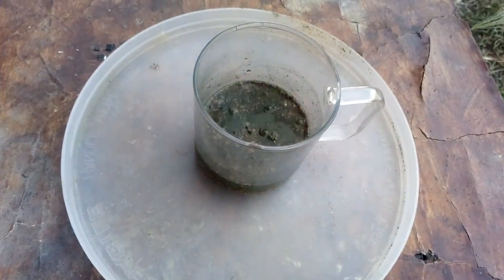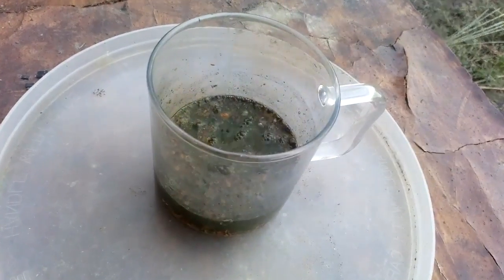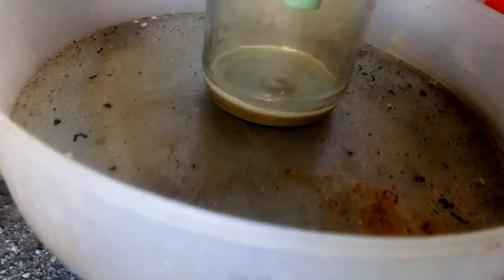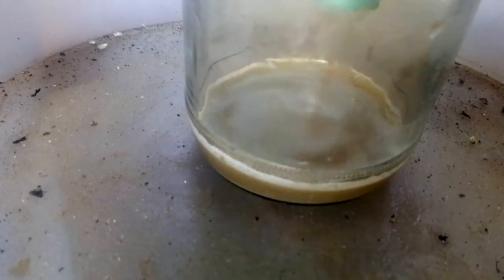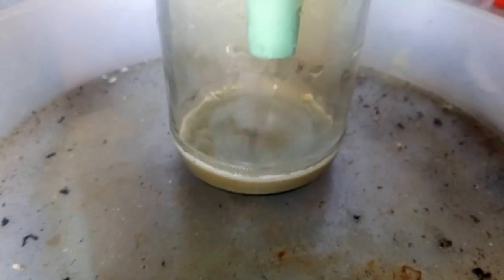In the meantime, we put some nitric inside the leftover shells — just a small amount, using the same nitric from the tantalum wash. We got some reaction, not too much but we got some. We're going to leave that now. I started to filter that solution — it's still dirty but never mind. We just want to drop some silver from it. I already got a little bit of silver because I washed the jar with tap water and the first couple of drops caused some silver to precipitate.